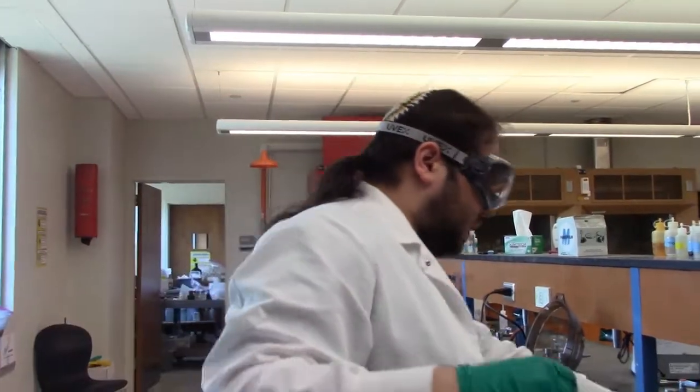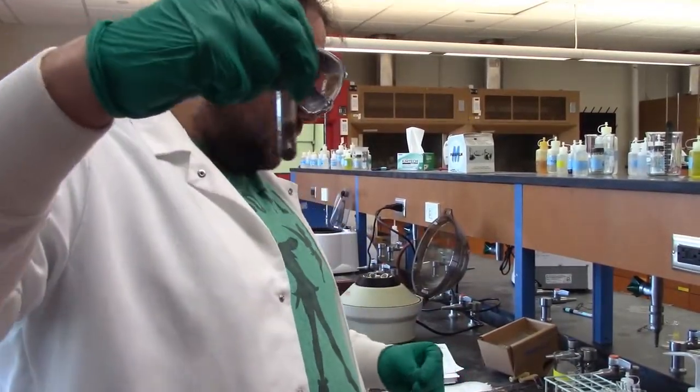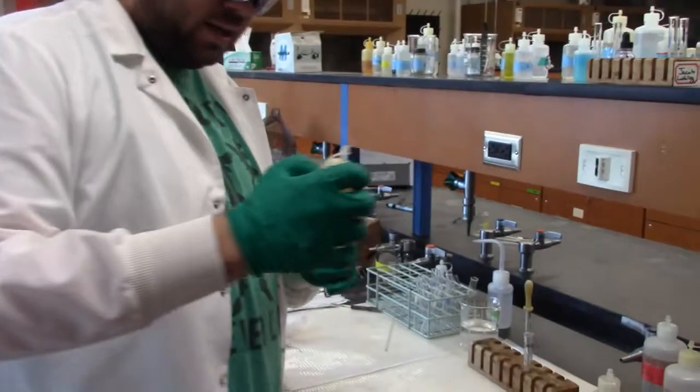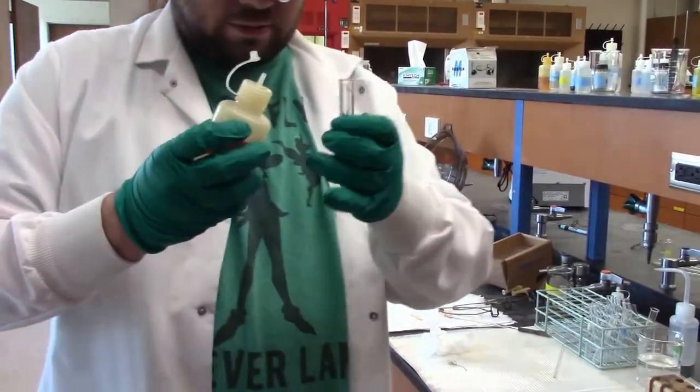So now we get to the fun part, when we get to test these for the different colorful cations, and it's also pleasant because it now smells significantly less like rotten eggs in here. So, one of these has it. Here it is, the KOH. We're going to add 20 drops of this.